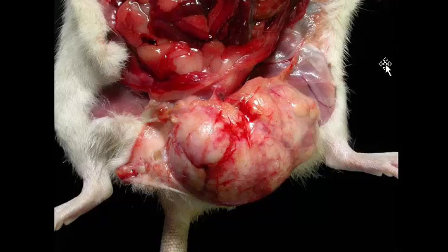These are benign tumors. Most of the mammary tumors in mice are due to retroviral infection, the mouse mammary tumor virus, which is present in the genome of just about every mouse out there. Rats don't have that. Rats get benign fibroadenomas. Histologically, they're a varying mix of fibrous connective tissue, a little bit of myoepithelium, and often functioning secretory material. The glands that you see may have large, clear fat droplets within them.